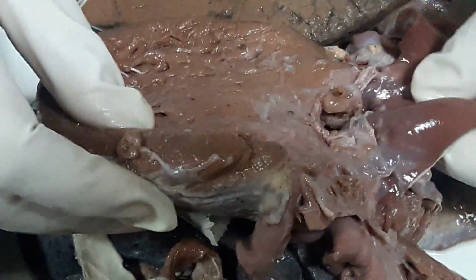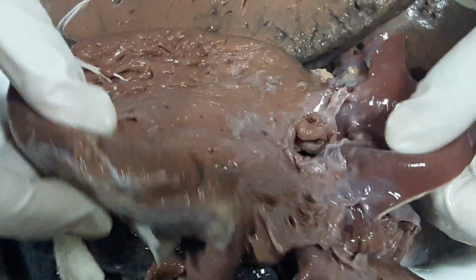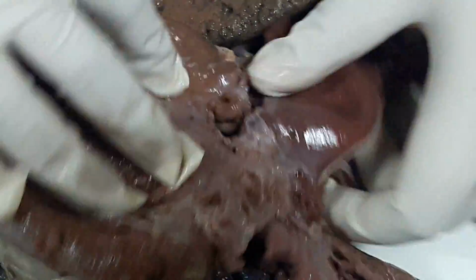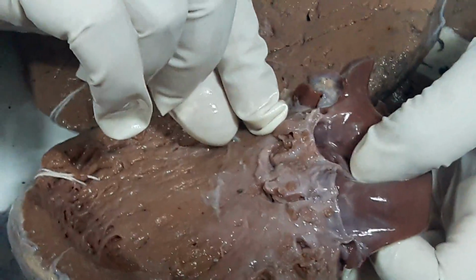Okay. So essentially, this patient had a VSD. And there is vegetation involving the atrium, and near the orifice of the VSD also you can see that there is a vegetation. Okay.